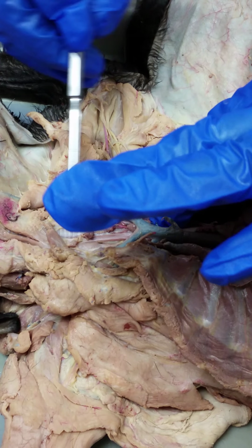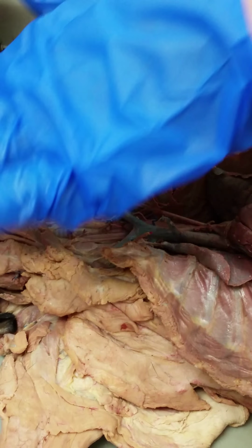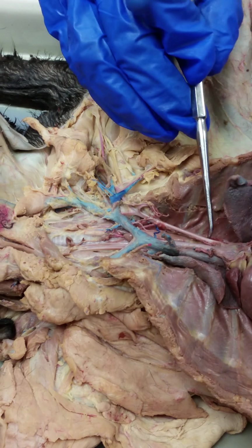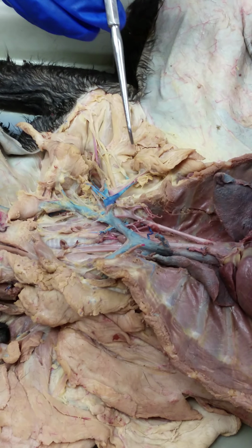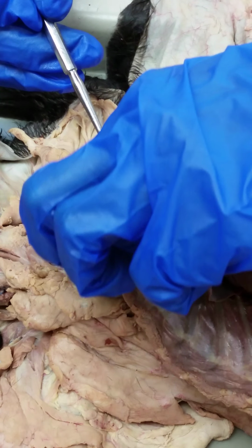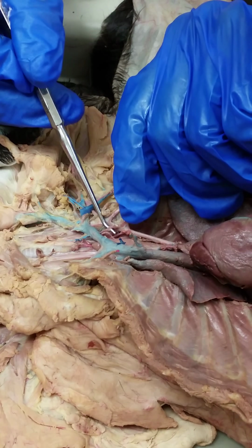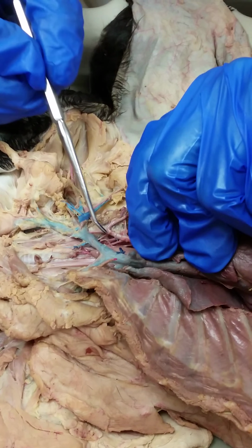So, common carotids don't have a lot of branching here in this area until you get later on. So we're going to jump back down here to our left subclavian artery, and this is the main artery that we're going to follow and identify several branches of, okay? So we already identified this ventral one here, the internal mammary artery. Okay, but there's three branches in a row here that are hard to dissect out.